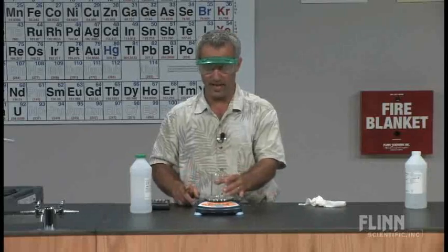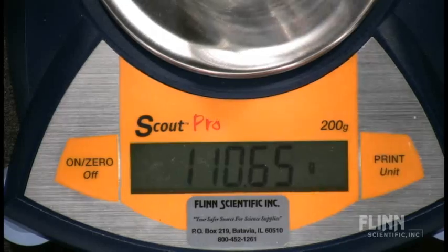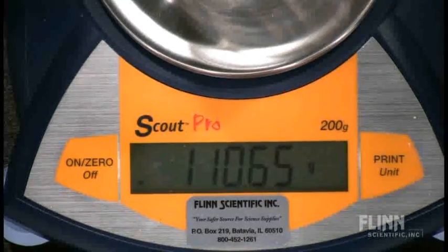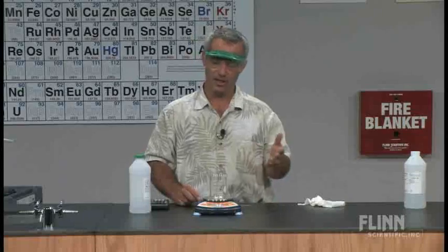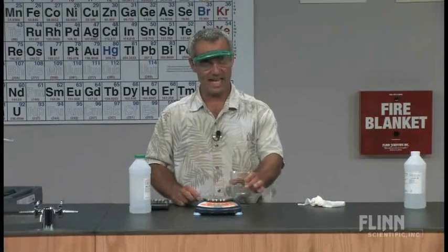Then to weigh that, and that's 110.65 grams. They write that down. And now the reaction.